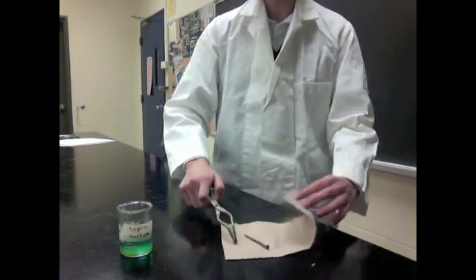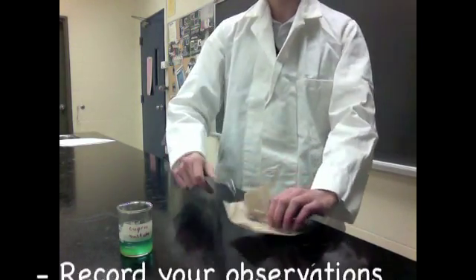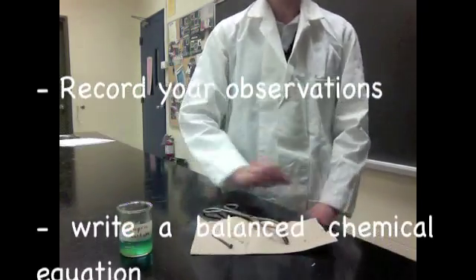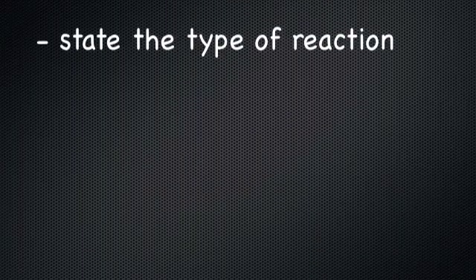Make sure that you wipe the nail before the next person does their lab and leave the cupric sulfate solution. Thank you so much.